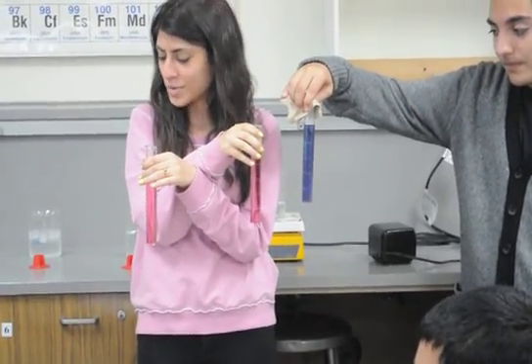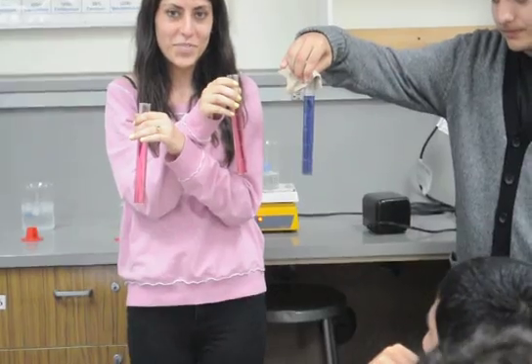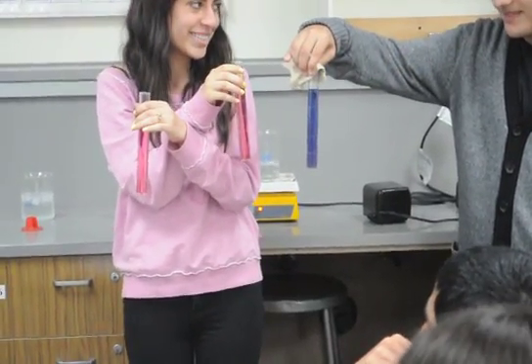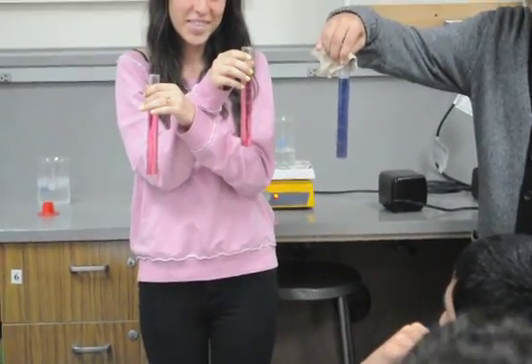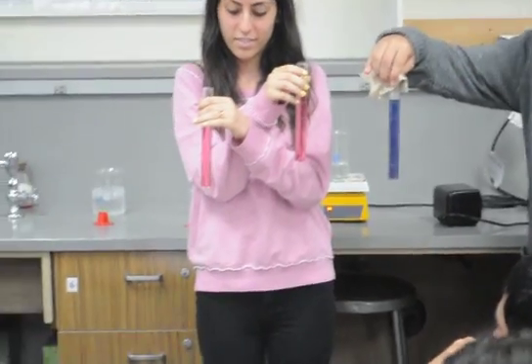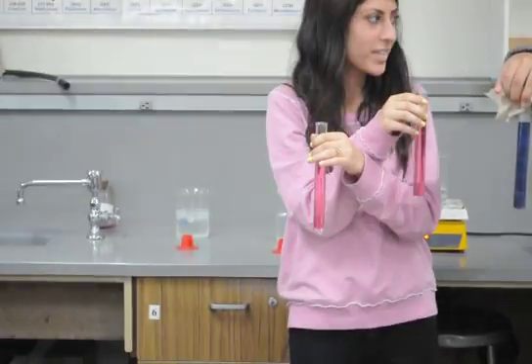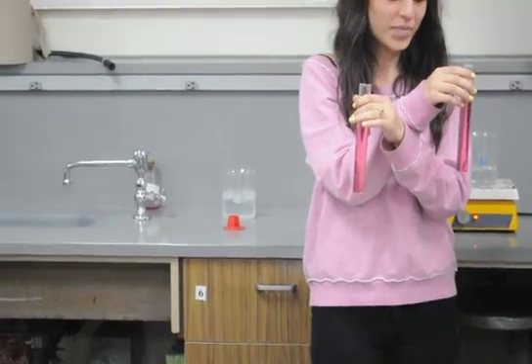So, Le Chatelier has done his job, and now we're going to switch. The hot water tube is going to go to the ice, and the ice tube is going into the hot water bath. Okay?